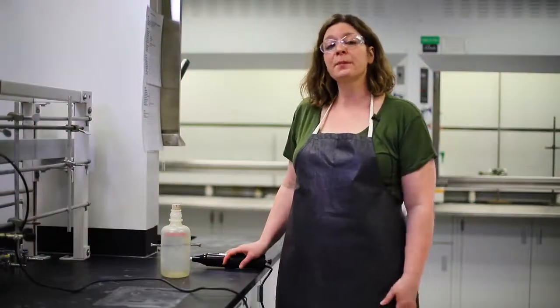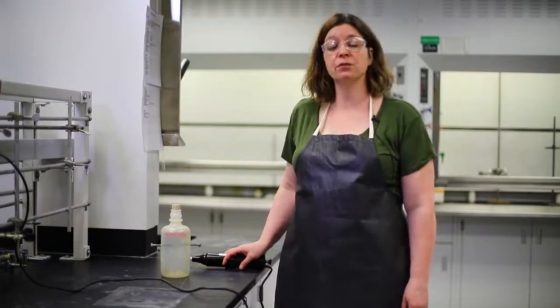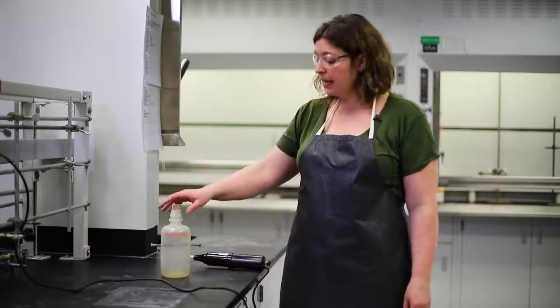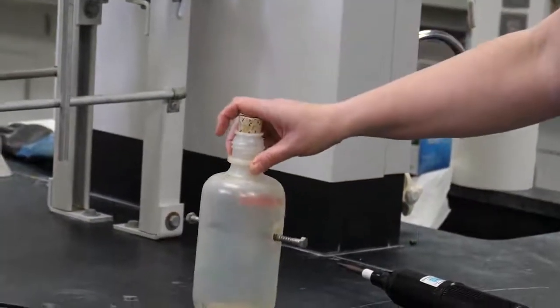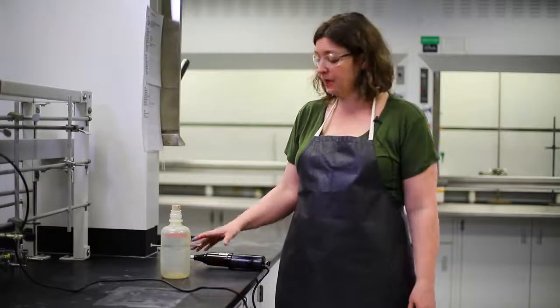So sometimes flammable reactions happen so fast that they put pressure on their surroundings. This is the technical definition of an explosion. In this Nalgene bottle, I have a small amount of ethanol. This is considered to be a flammable solvent, and it produces vapors that can catch fire in the right circumstance.